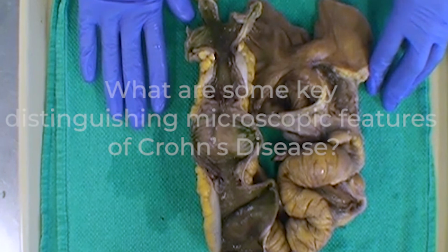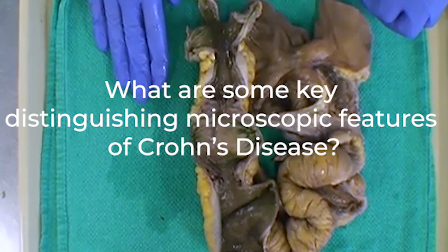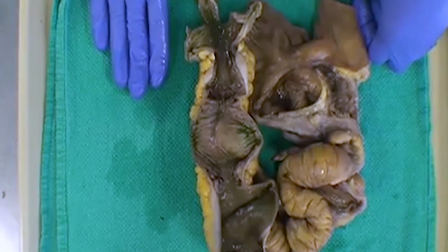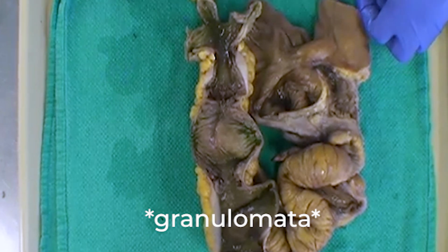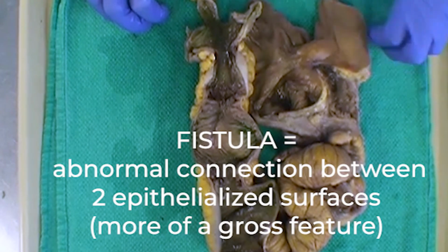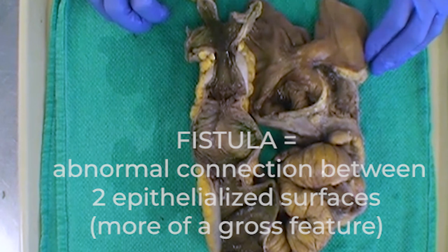Are there any key microscopic features that anyone wants to comment on that could help us distinguish between a case of Crohn's disease like this and UC as we just saw in the previous case? So histologic features specific to Crohn's disease. Granulomas, perfect. So granuloma is the anglicized version, or granulomata if you want to be ancient Greek. We have fistula as well. So fistula is more of a gross feature, I would say. A fistula is defined as an abnormal connection between two epithelialized surfaces. And so we would see that grossly and then comment on it microscopically.